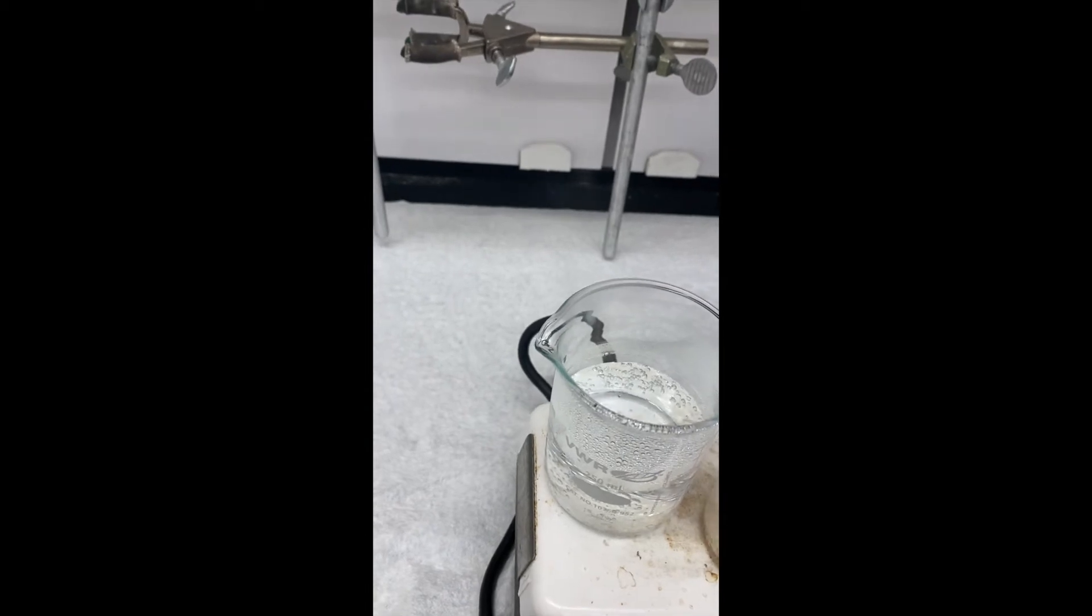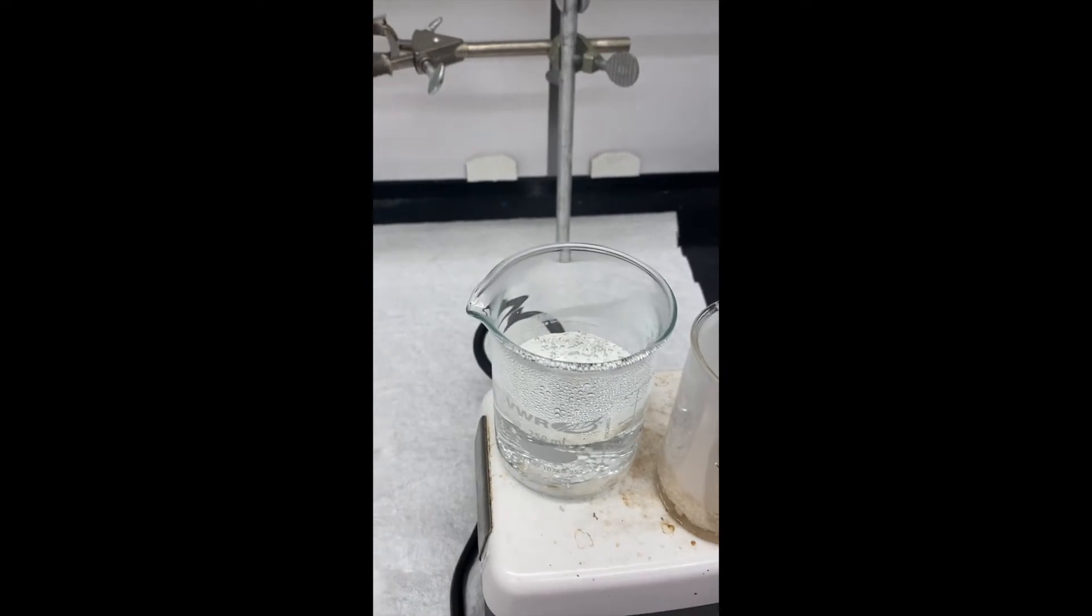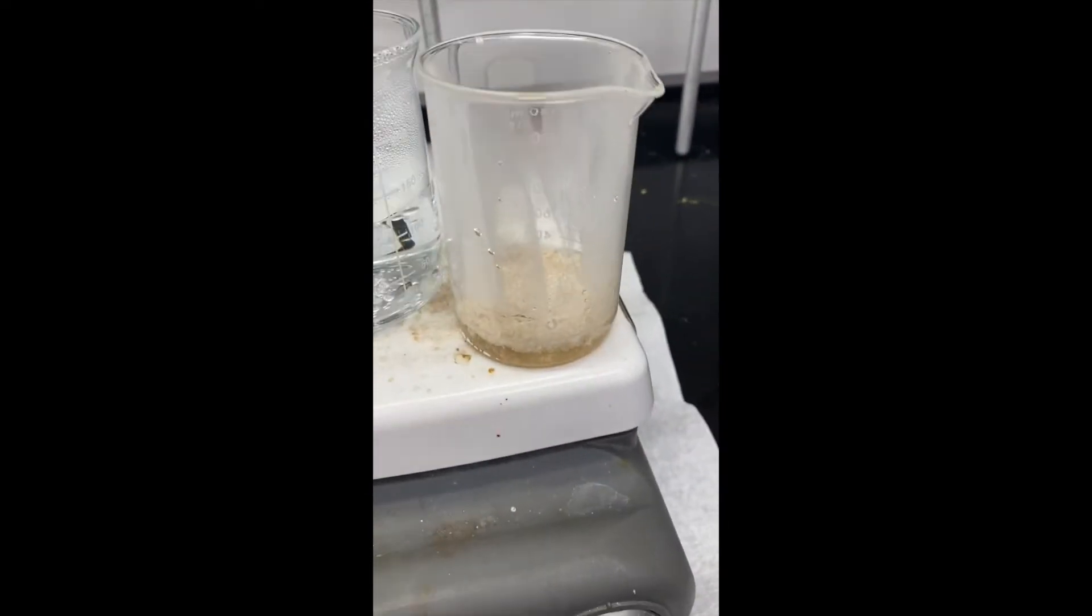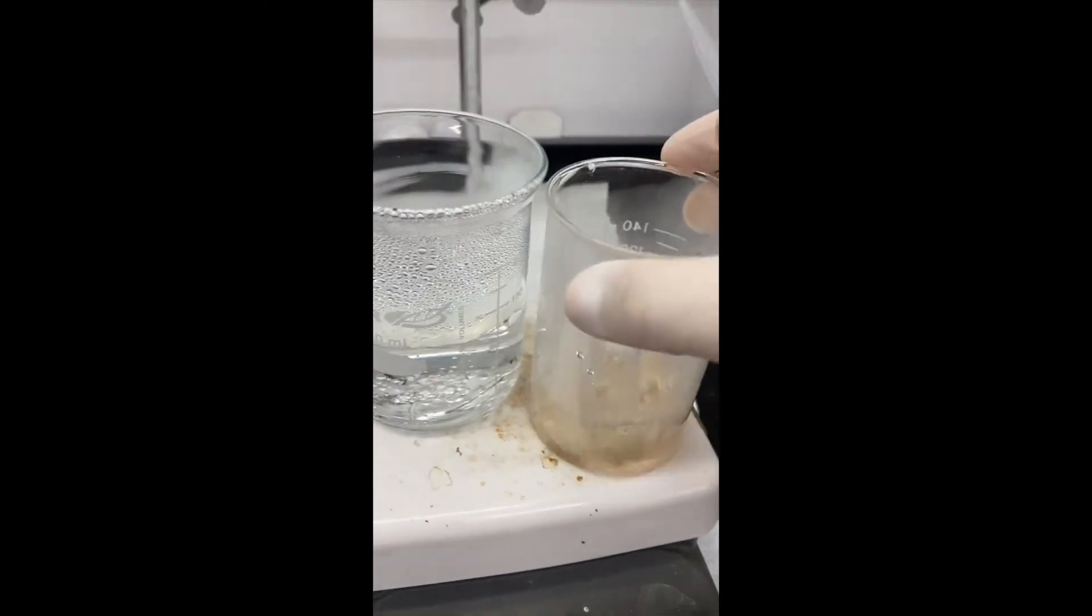And then I can just keep adding some solvent to my solid. So I could let that go for a little bit and get that heated up, see if this will dissolve.